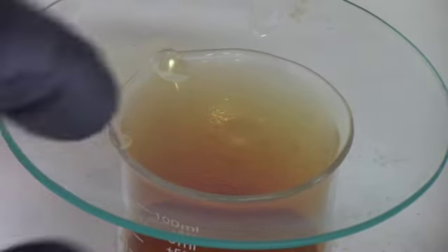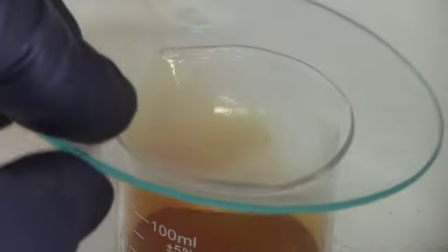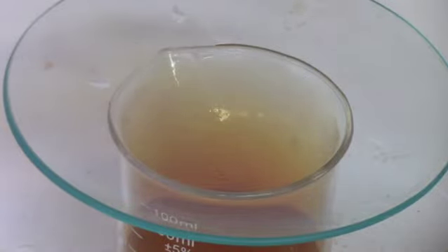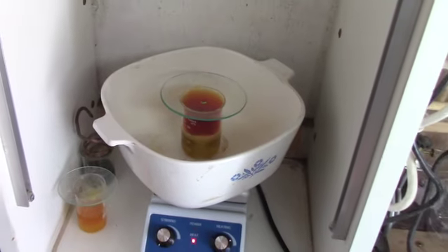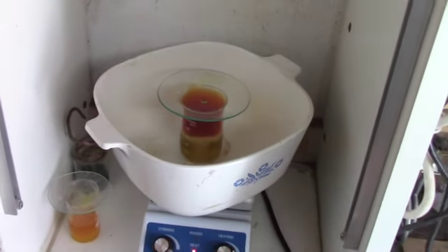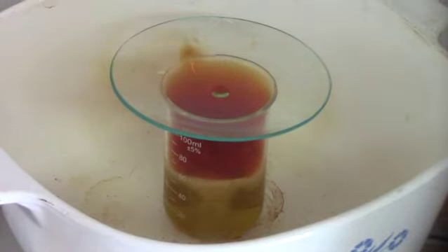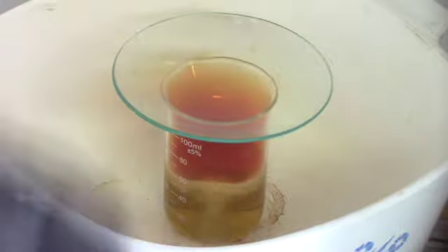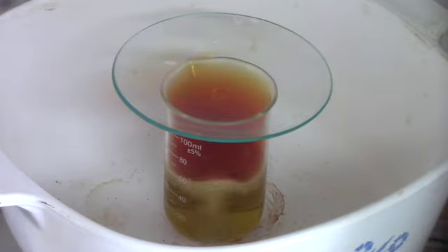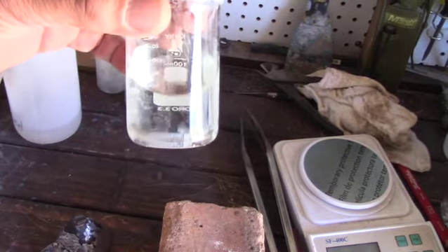There's your brown gas — if you're going to be doing anything with nitric acid, do it in a fume hood; if you don't know what a fume hood is, stay away from nitric acid. We even have a blast shield here just in case something pops and throws nitric all over the place. This stuff is putting out more noxious gas than my cat. We're really boiling away at that silver now — the silver is going into solution. Once it had all dissolved, I let it sit overnight and the solution actually came out clear, which startled me — I figured it would have a color and thought there was no silver left.